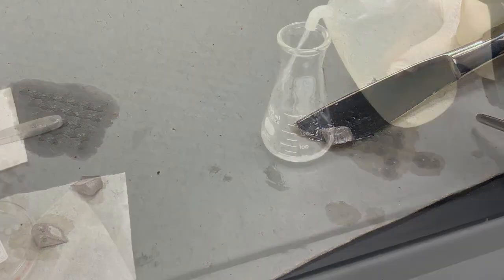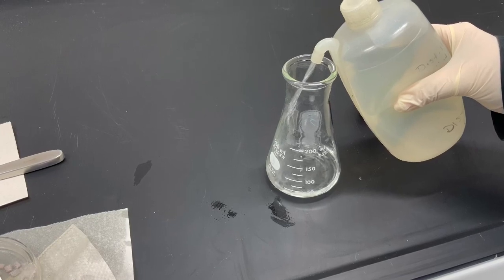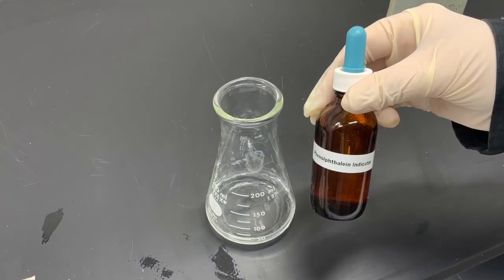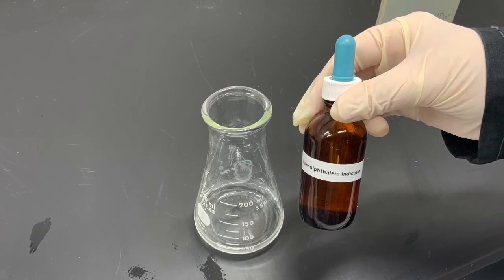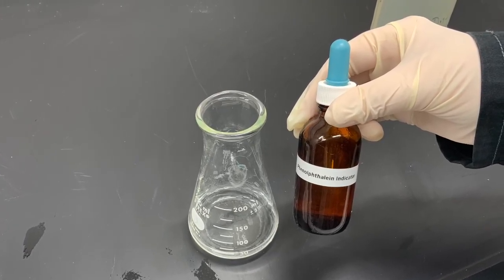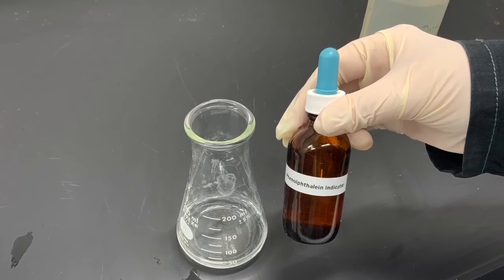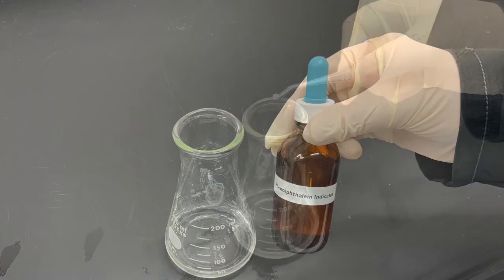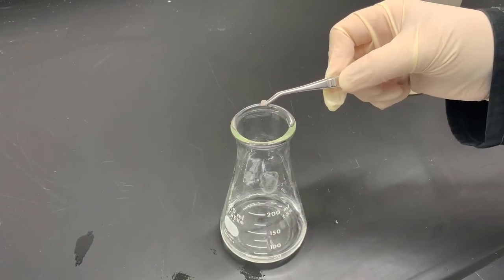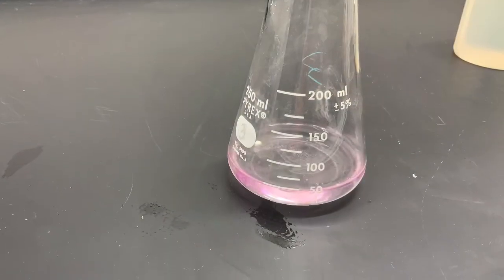You may have seen in high school that sodium reacts vividly with water. So we fill an Erlenmeyer flask with water and add some drops of an indicator called phenolphthalein. This indicator turns pink in alkaline, also called basic solutions, when there's very low acidity in the solution. So watch what happens when we add a small piece of sodium to the water in the Erlenmeyer flask.